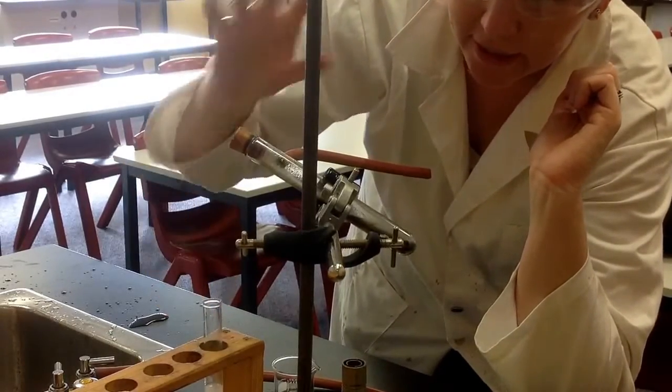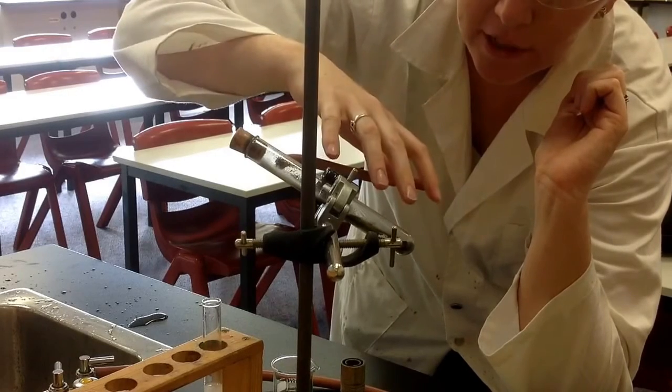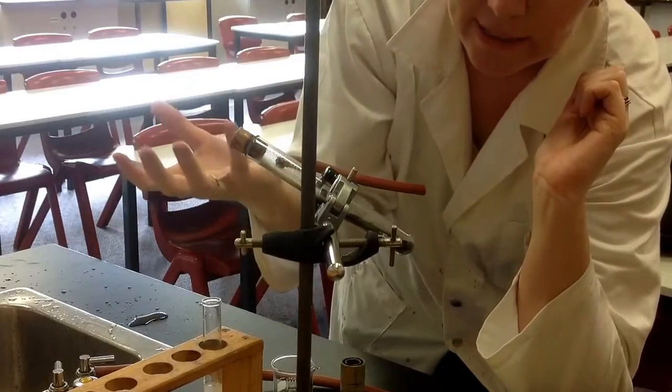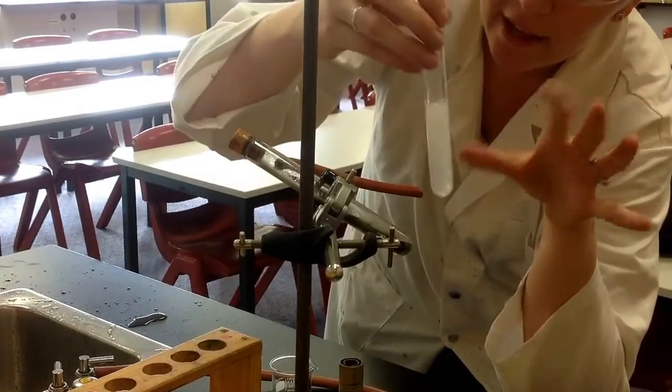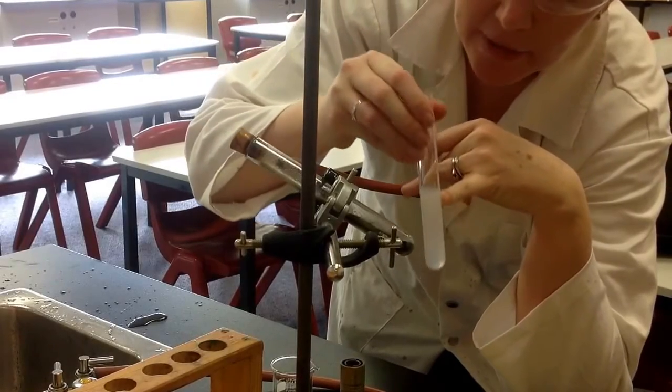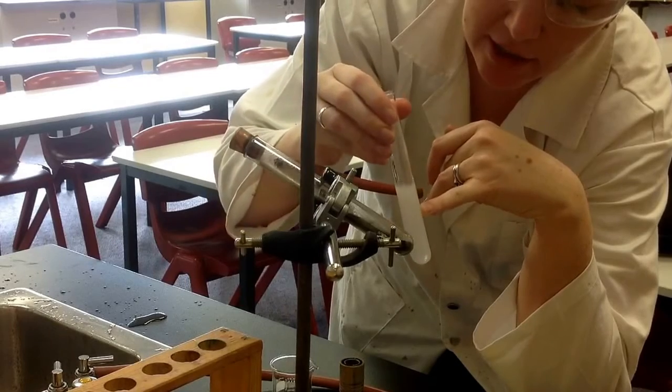There's two reactions that are happening here. The first one is the copper carbonate is being decomposed into copper oxide and the CO2 that's left from this has been sent up as a gas and I've captured it in the lime water. And this is a positive test for carbon dioxide gas.